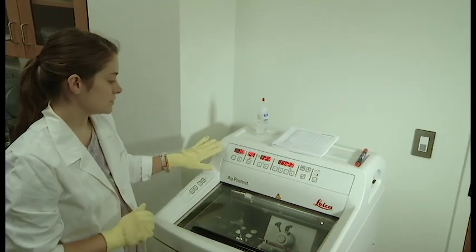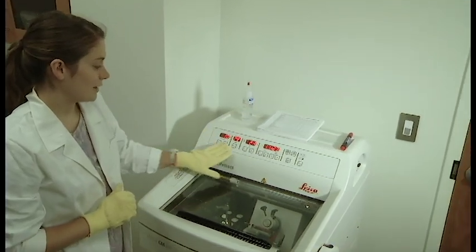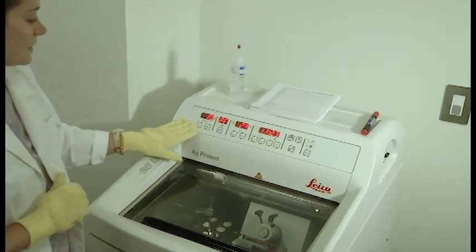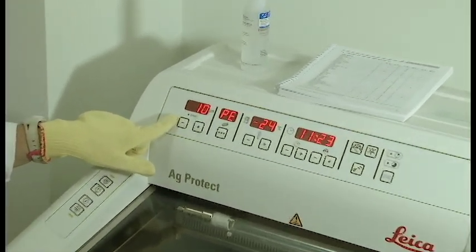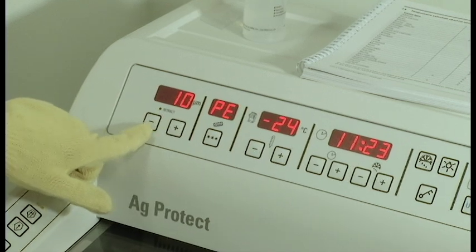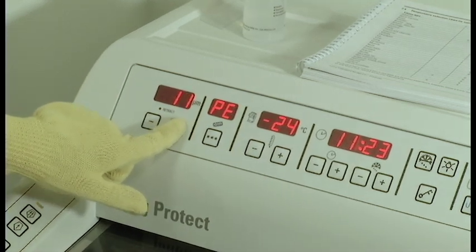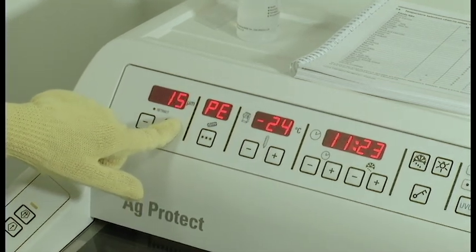When you're first starting to use your cryostat, you have all these buttons at the top that you can set. Here is the thickness of the cut that's going to be slicing. It can go from very low to very high.